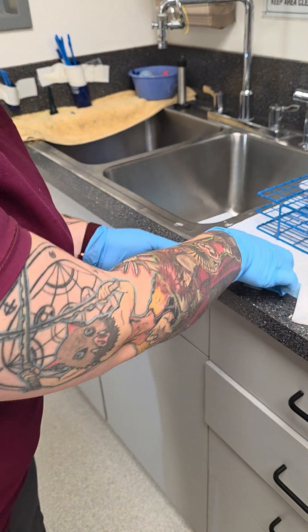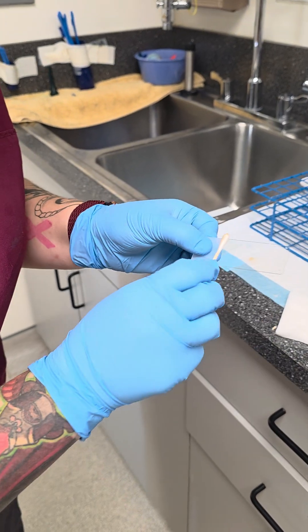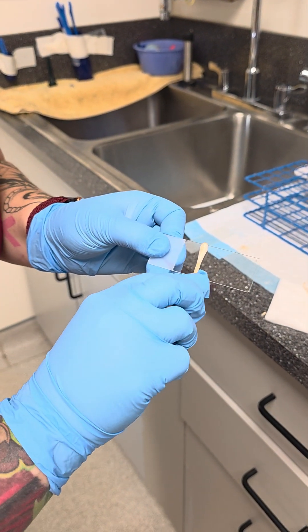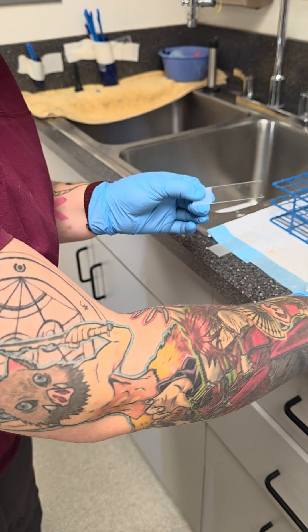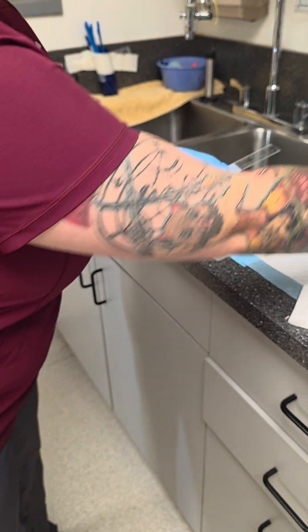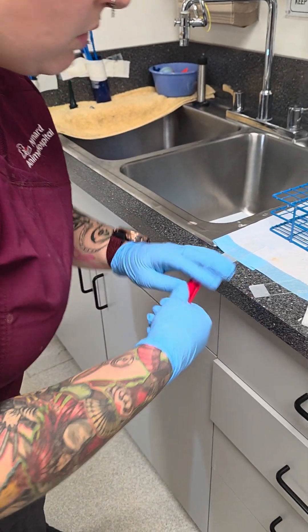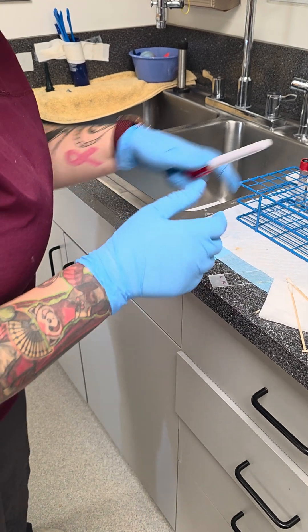So that's one way of doing it. Again, find your frosted, or you can do left on top and roll out just a single layer, then do right on the bottom. With this, make sure that you label left and right as to what it is.